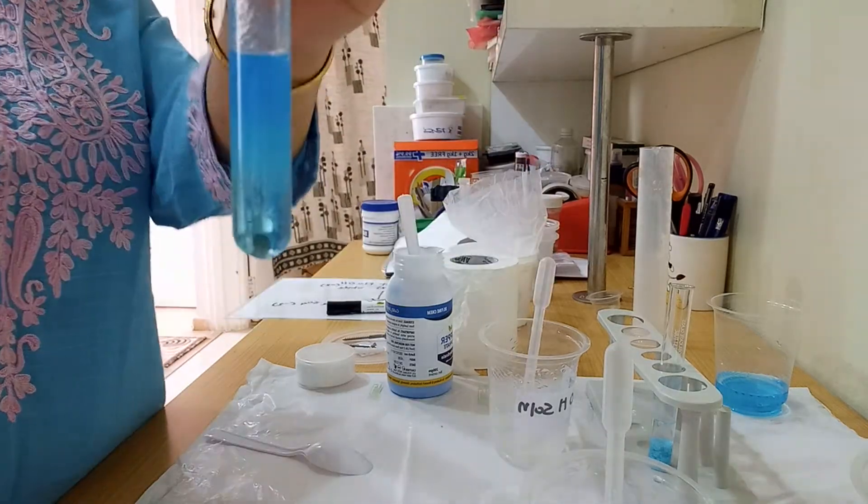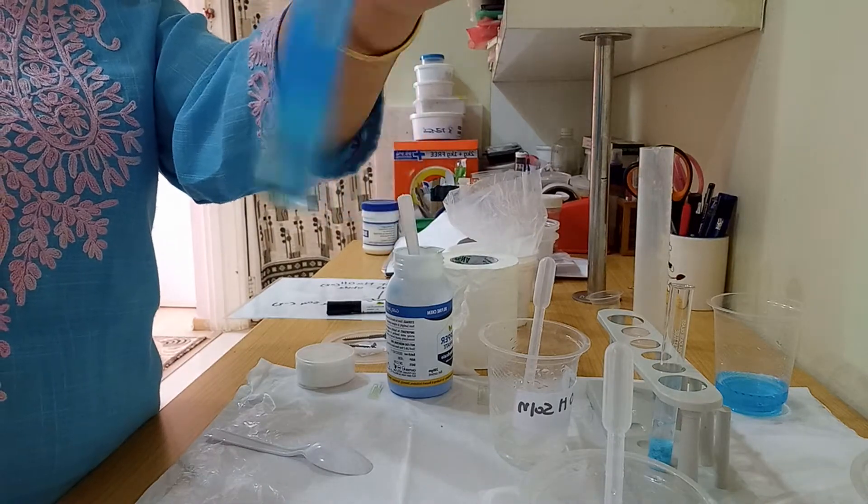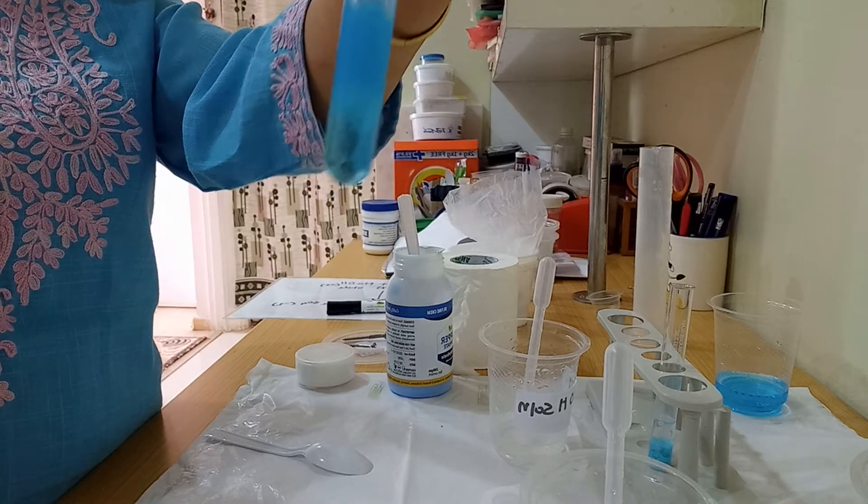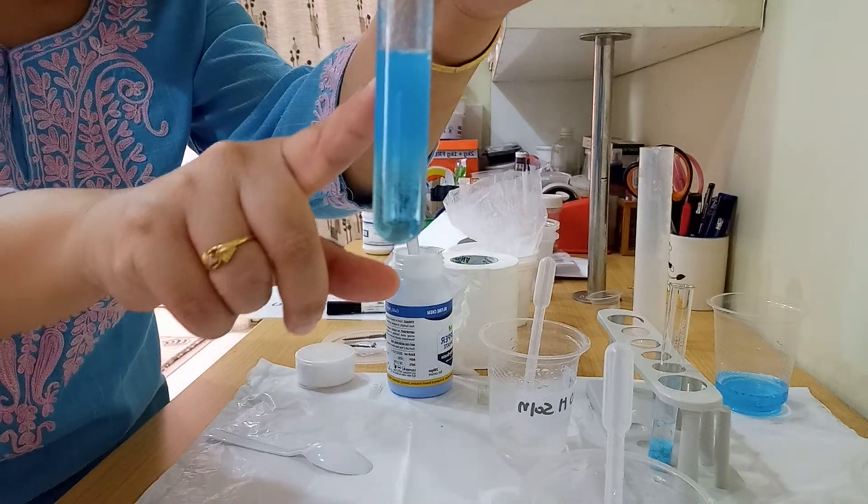Can you see now? Let me stir it properly. Can you see the precipitate forming here?